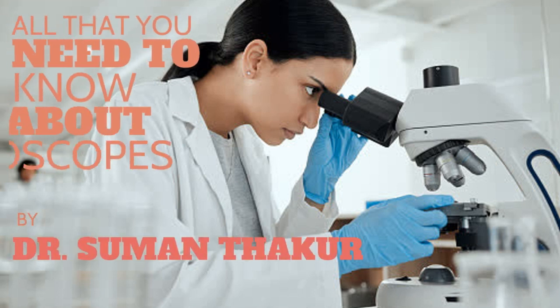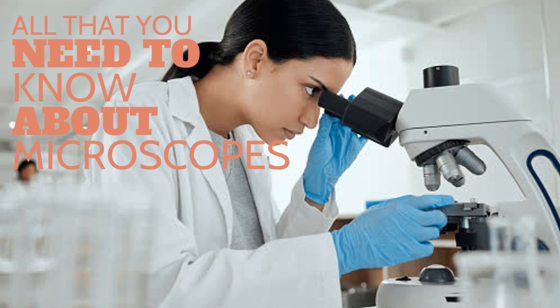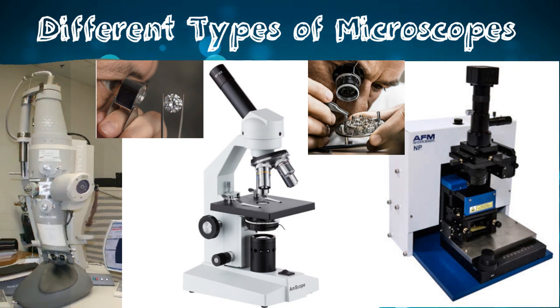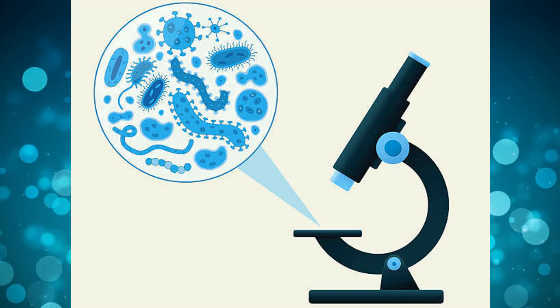Hello everyone. Today I'm going to take you to the world of microorganisms through the magnifying instruments called microscopes. I'll show you the difference in the pictures obtained using all these different types of microscopes. Microscope is a window to the invisible world of microbes.